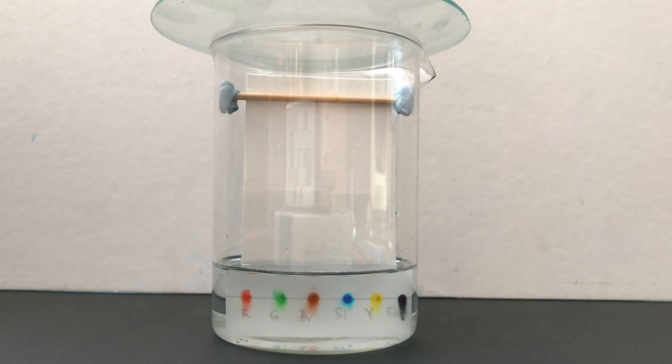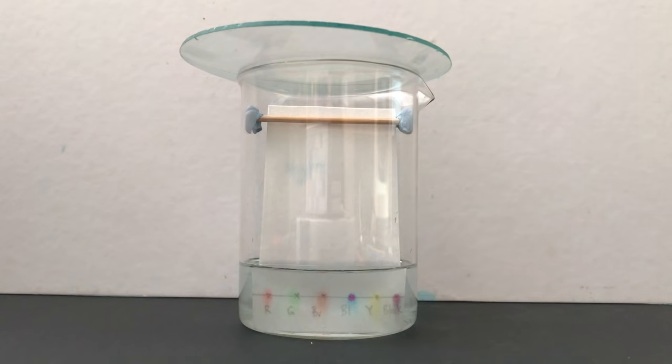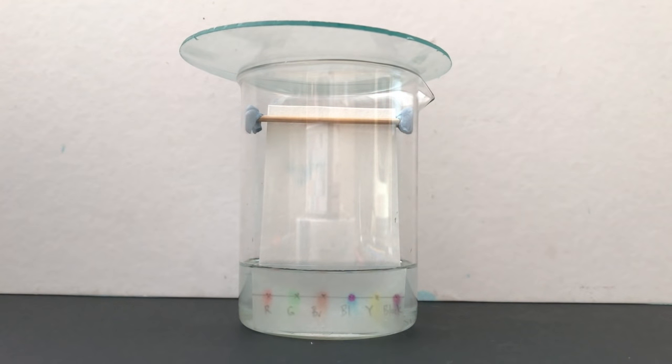We observe that the different inks do not get carried up the paper, but instead dissolve in the solvent. The inks cannot be separated.